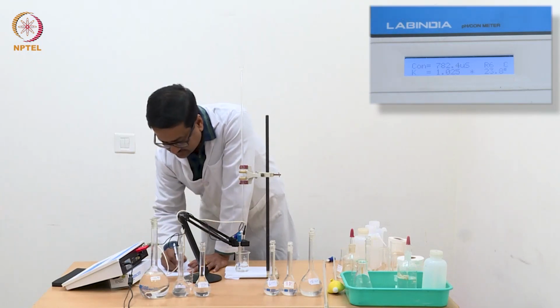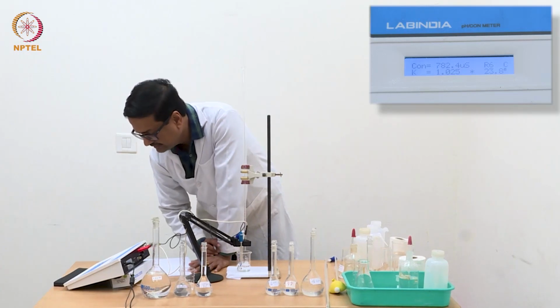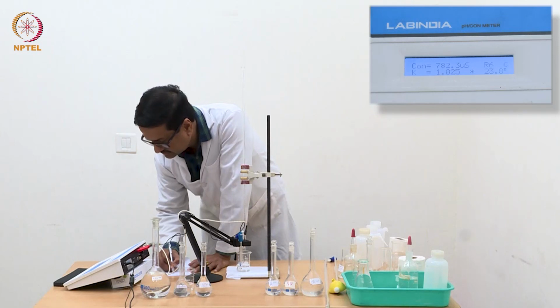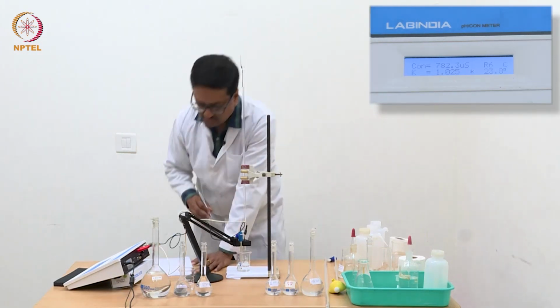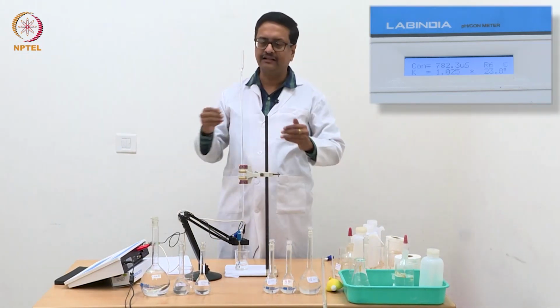Remember that here the reading is already in microsiemens. So, we write down 782.3 microsiemens. That is my starting point.